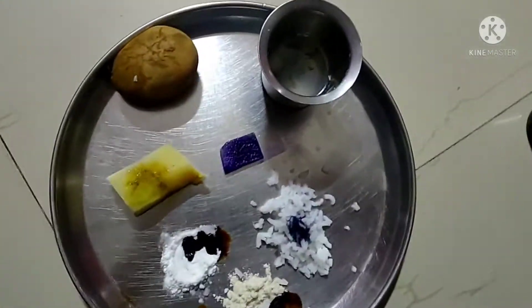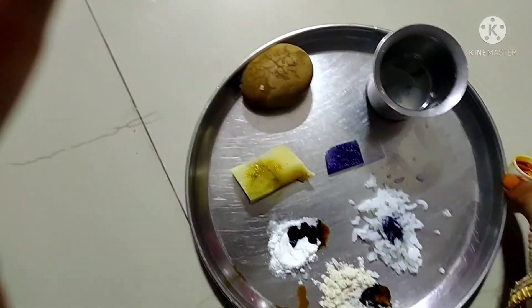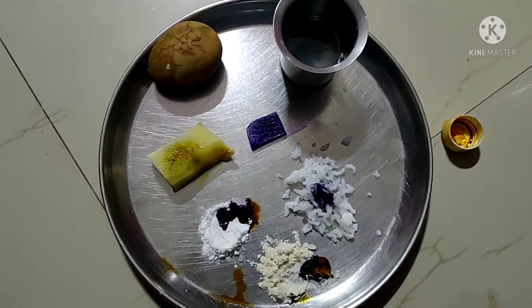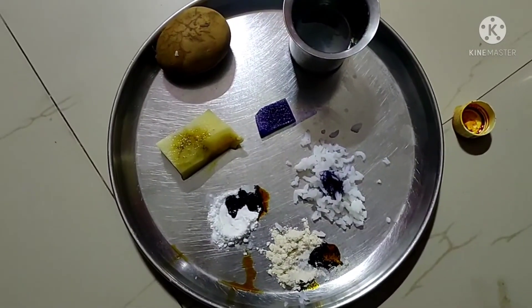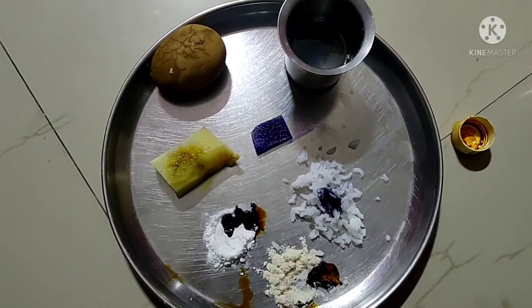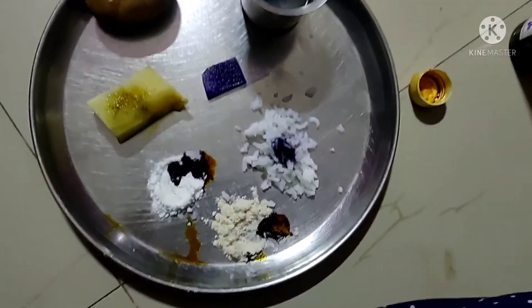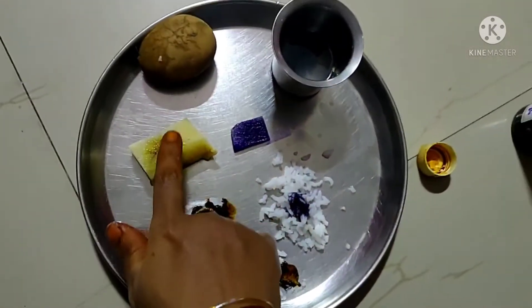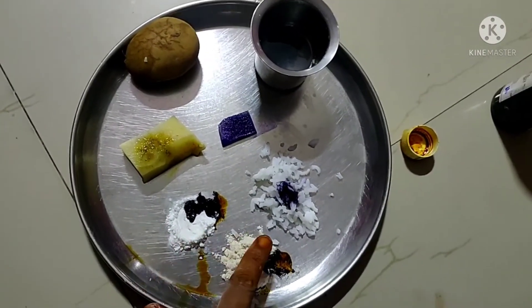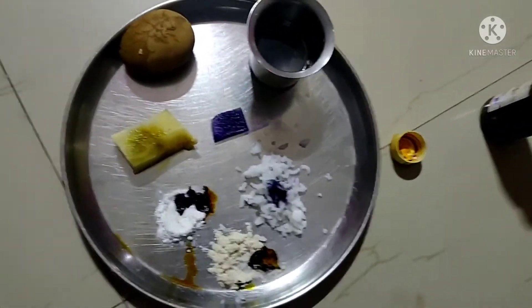See, the color changes into blue. So all these food items contain carbohydrates. To prove that these food items contain starch, the examples of starch food items are: potato, rice flour, wheat flour, rice, and rice water.